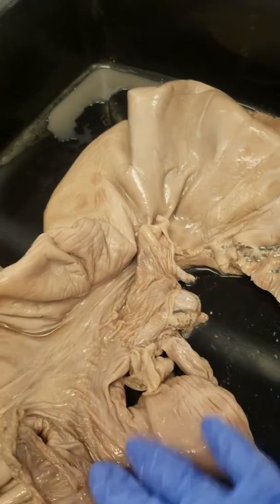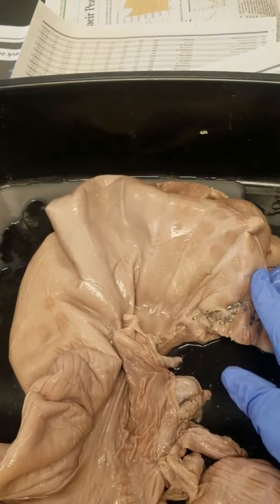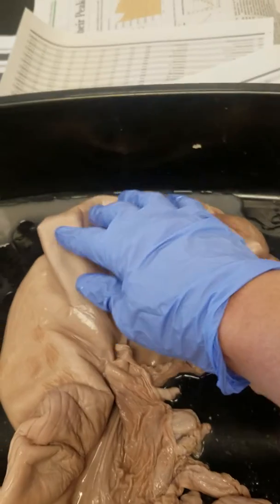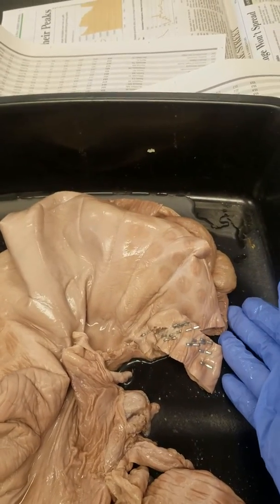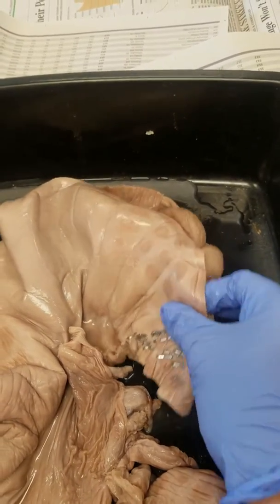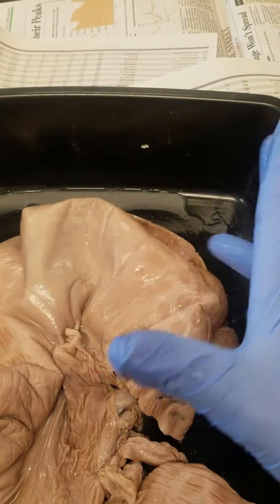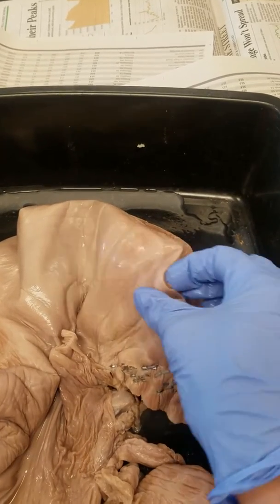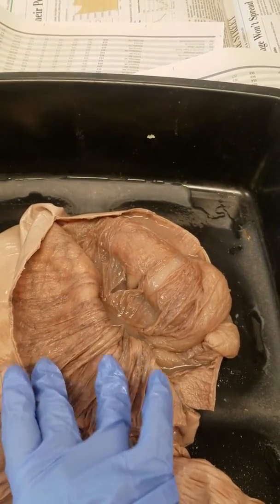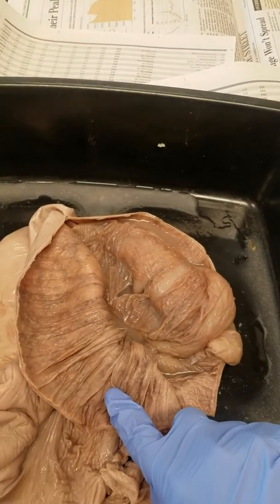What I've done here is I'm going to extract a fetal pig from the right horn of the uterus — so the right, my right, but the pig's left. The arch of the uterus at the top is called the fundus. I have made a mid-sagittal cut along the fundus of the uterus and I am going to pull this back. By the way, this outer covering of the uterus is called the perimetrial lining. And then as I retract it back, this is the endometrial lining. So if you ever hear of people with endometriosis, they have disease on the endometrial lining here.